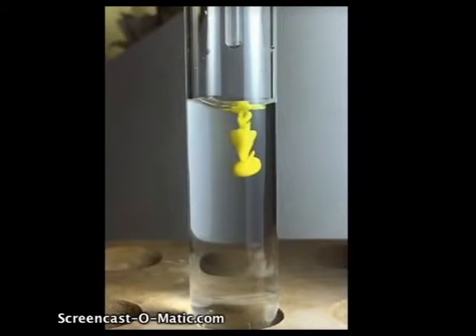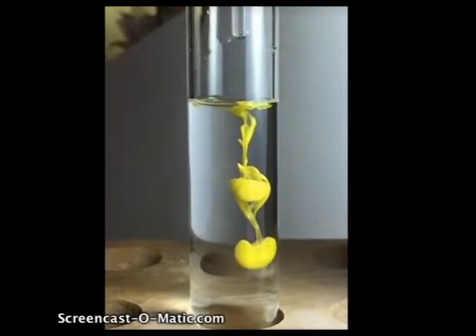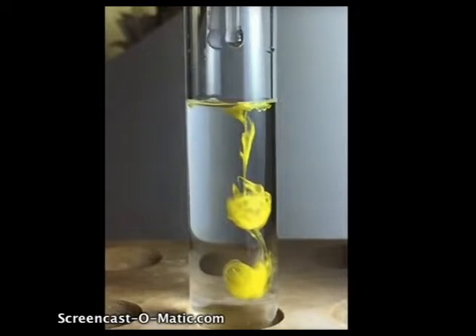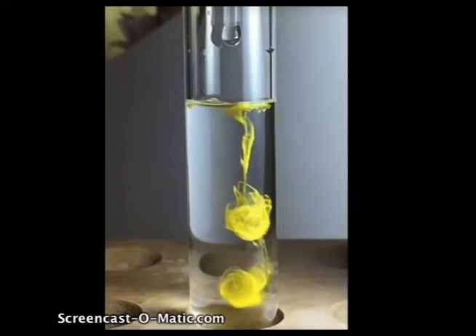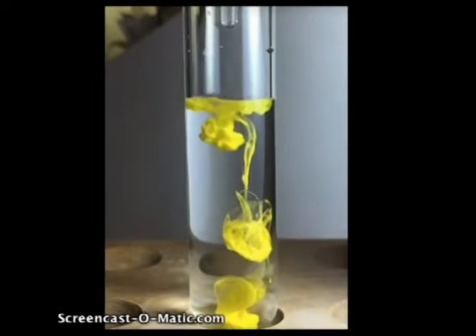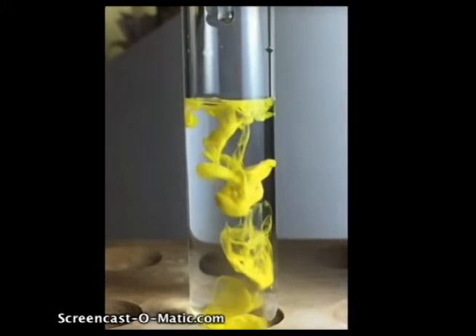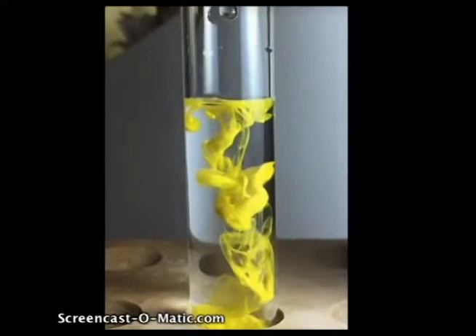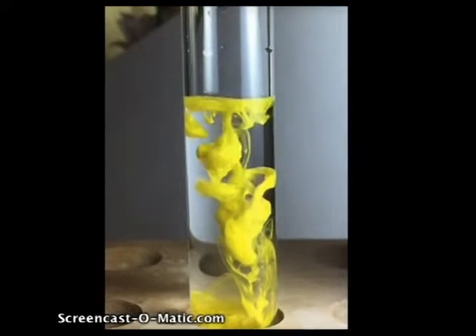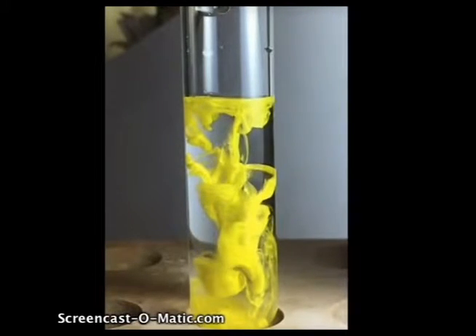In this reaction, you see a clear solution of lead-2 nitrate in the test tube. As the reaction proceeds, what we're doing is we're putting drops one at a time of a potassium iodide solution into the lead-2 nitrate. And as you see that solid yellow cloud forming, you'll see that that is the actual reaction between lead-2 ions and iodide ions, forming lead-2 iodide. That is not soluble in this solution. We call that a precipitate.